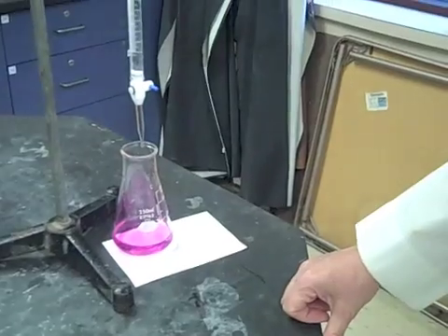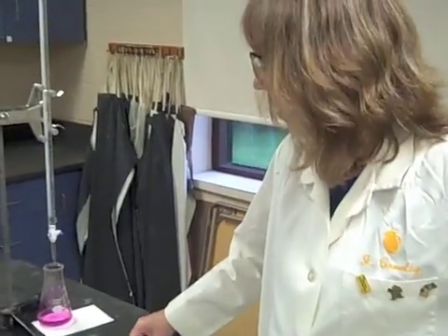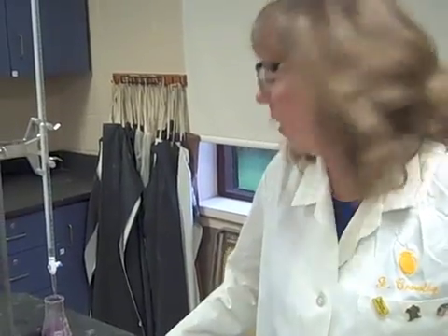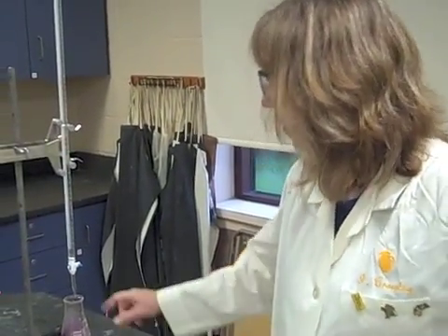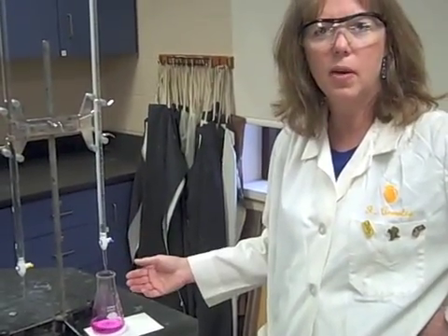Now, I'm really having a good day with burettes. Did you notice that this burette is leaking? So, if that were happening, you would go back to the coordinator and you would get another burette. And the reason why I know that is after I put water on it once, there's another drip coming off.